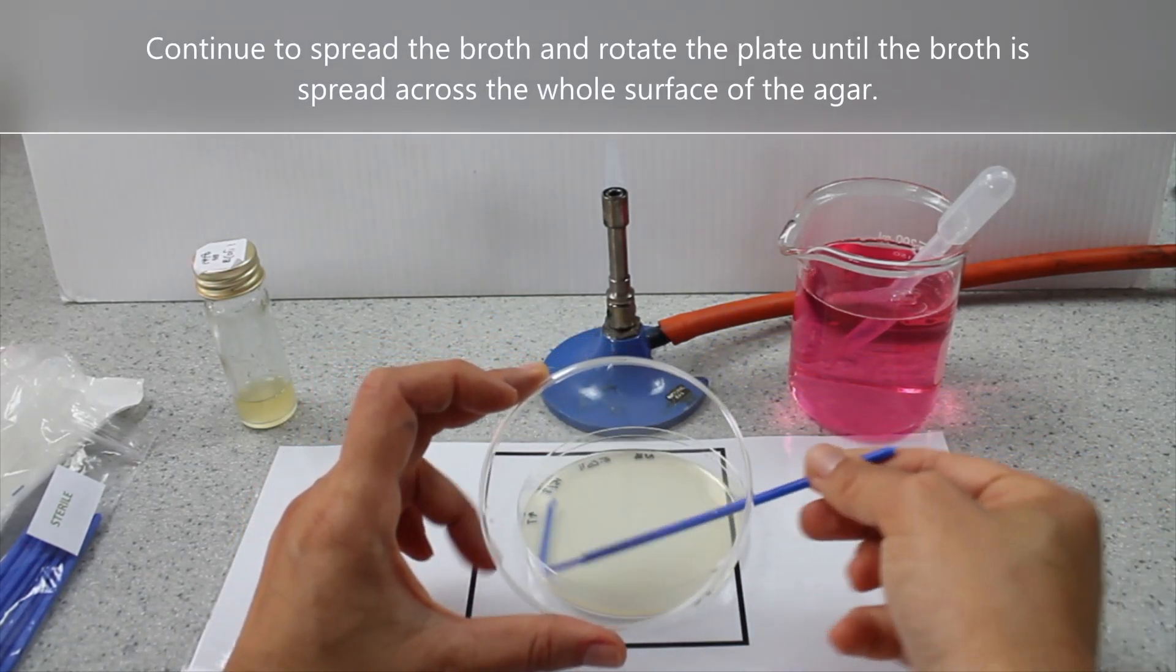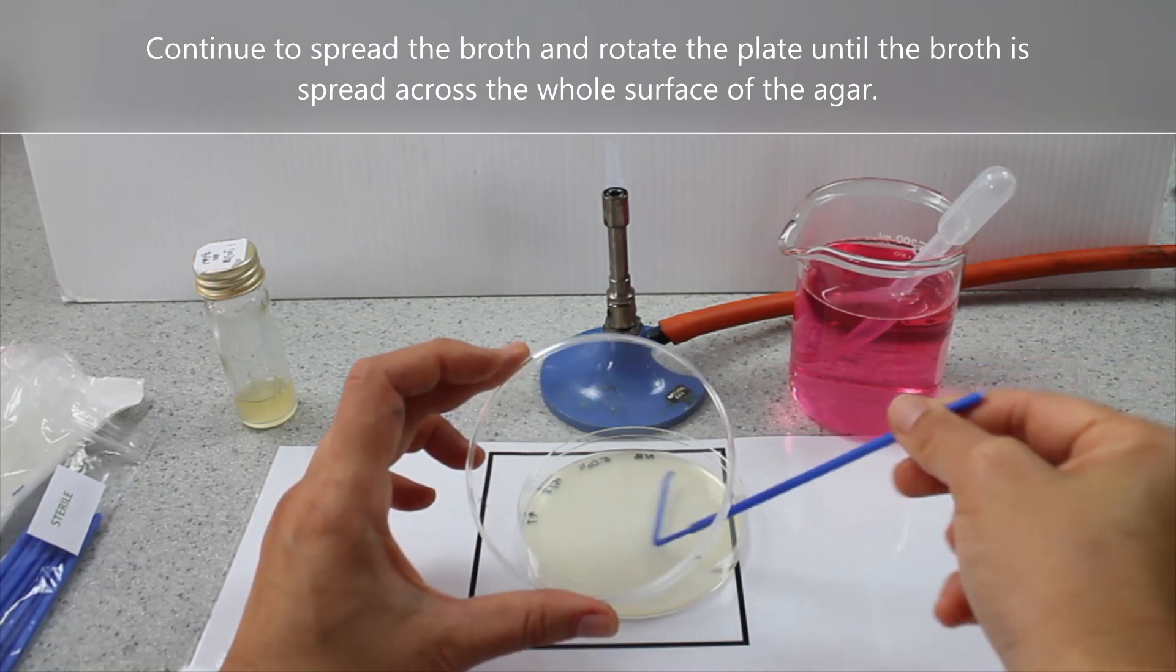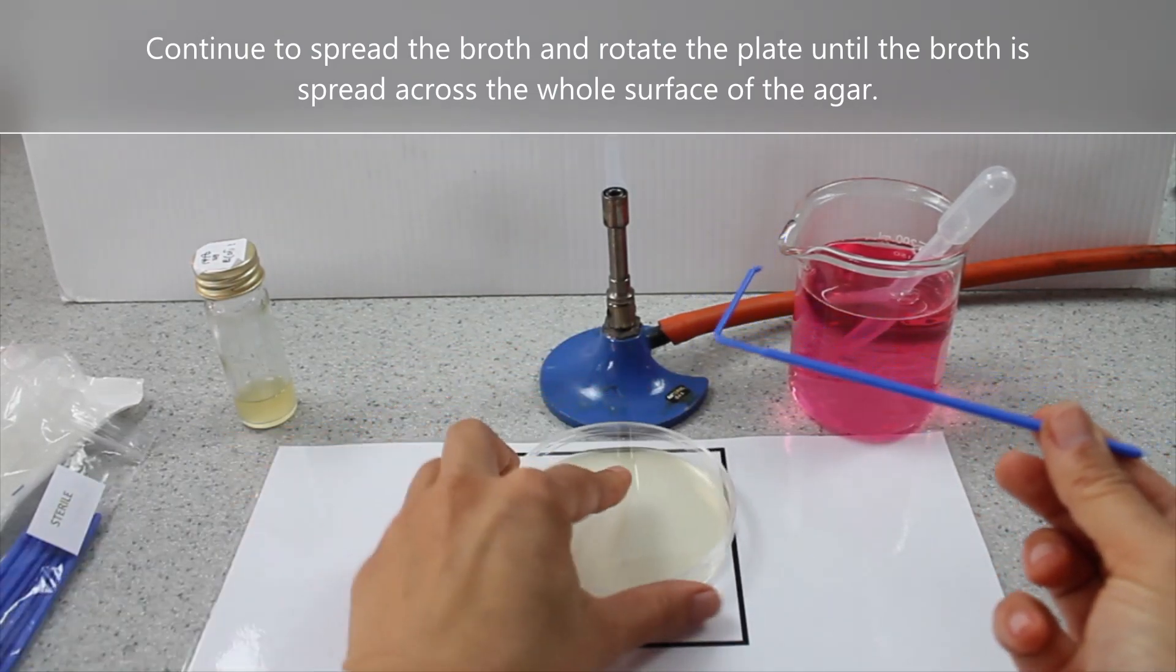Continue to spread the broth and rotate the plate until the broth is spread across the whole surface of the agar.